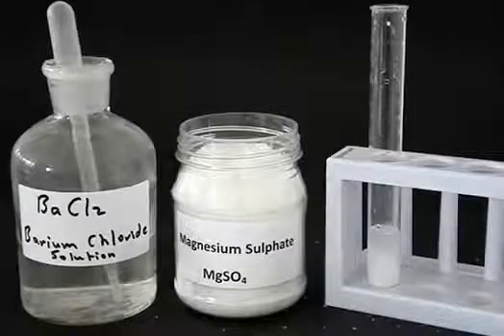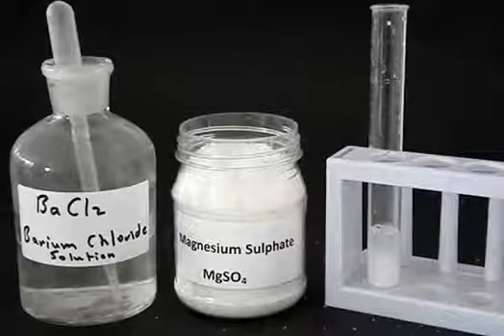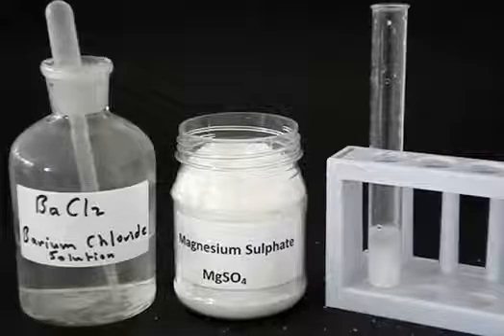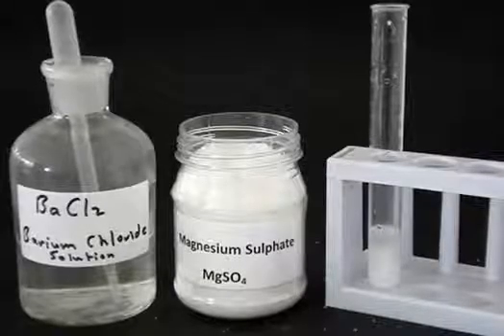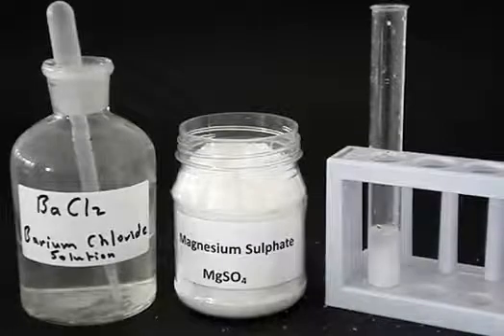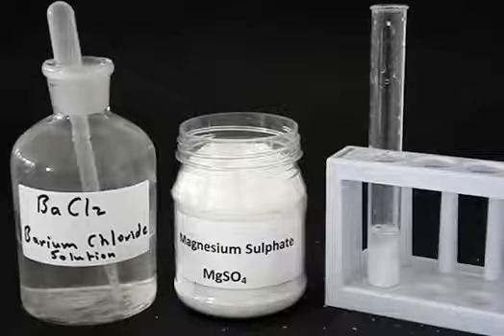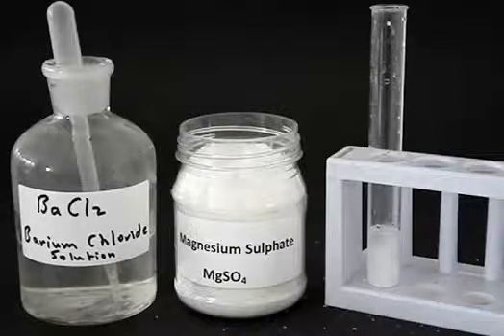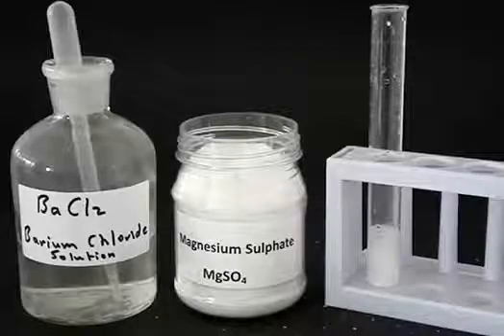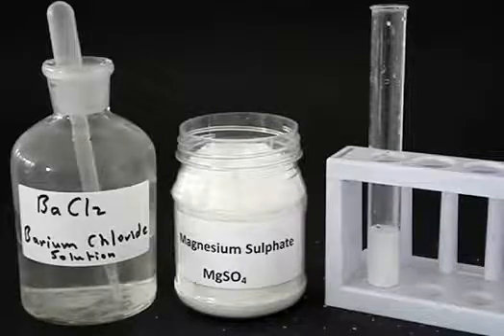So the test for a sulphate is: add barium chloride solution to a solution of the unknown salt. If a white precipitate forms, then probably the unknown solution was a sulphate.